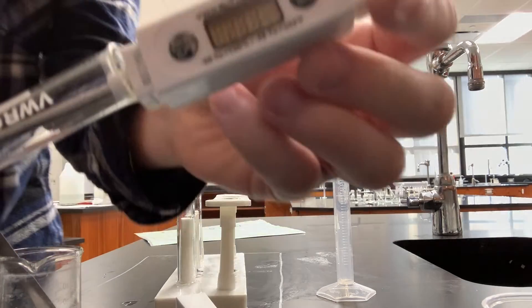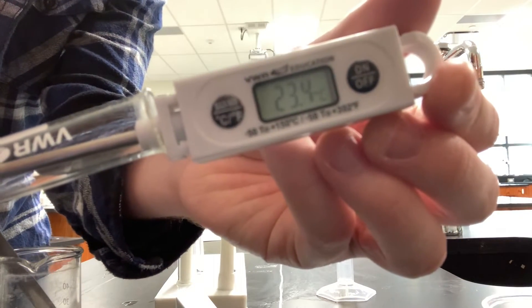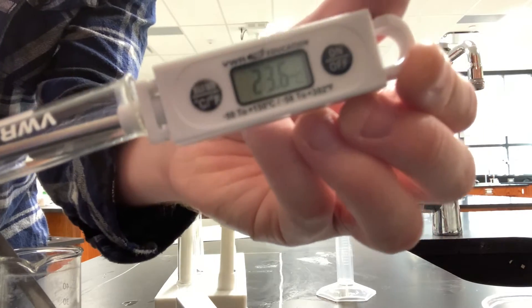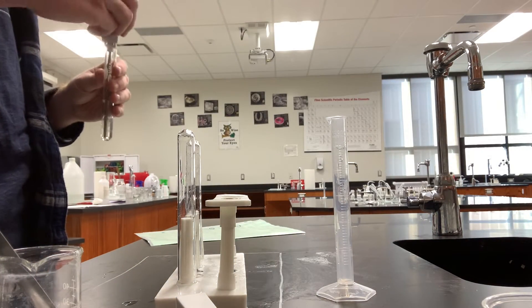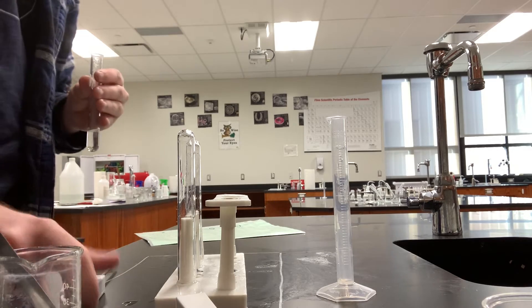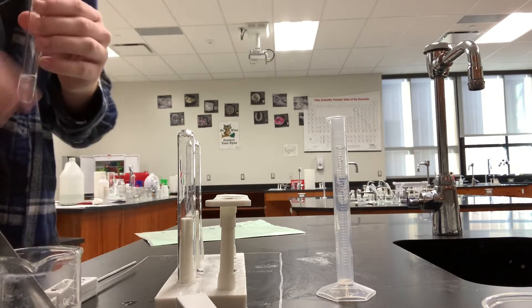Now it's about 23 degrees. So it went from about 18 to 23.